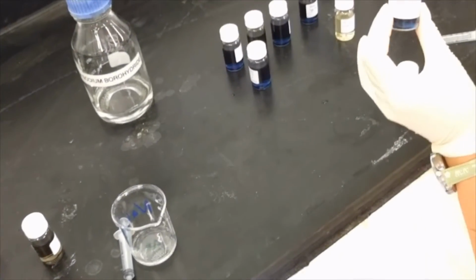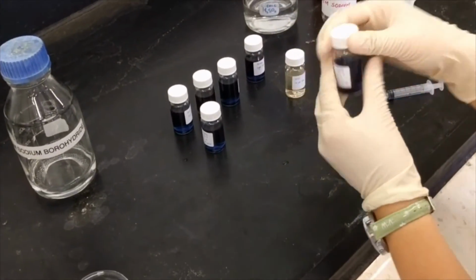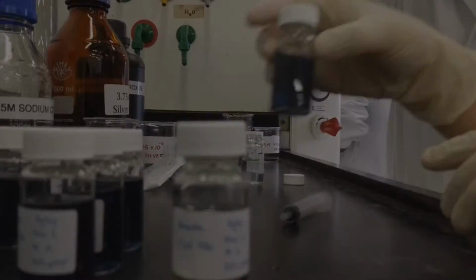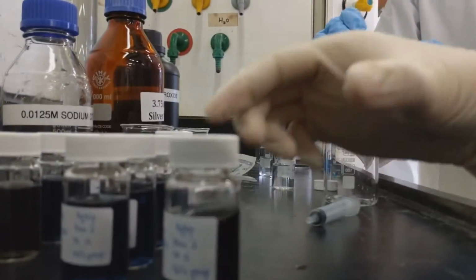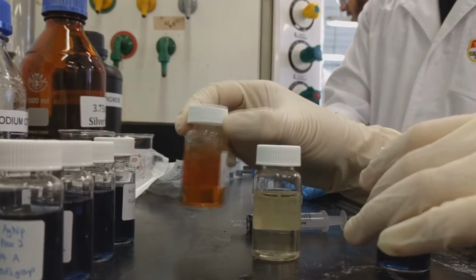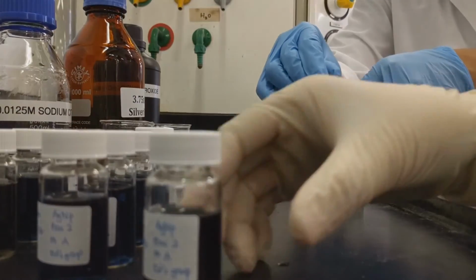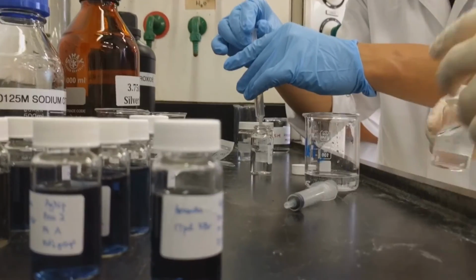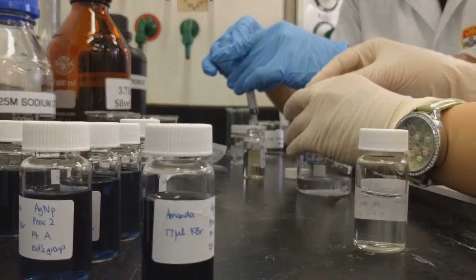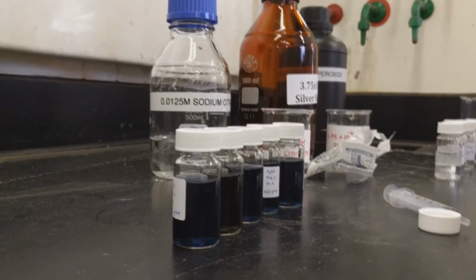To do that, we change the amount of potassium bromide added. Bromide ions bind to the surface of silver nanoparticles to form silver bromide. Hence, more silver atoms cannot be added to the nanoparticle, and thus it cannot grow in size. Hence, the more potassium bromide we add, the smaller the nanoparticle size. By adding different amounts of potassium bromide, we've managed to get all these pretty colors. We've managed to make our rainbow silver.